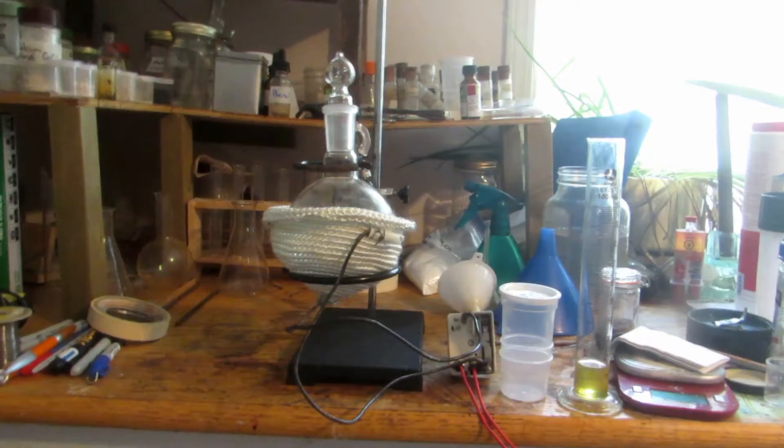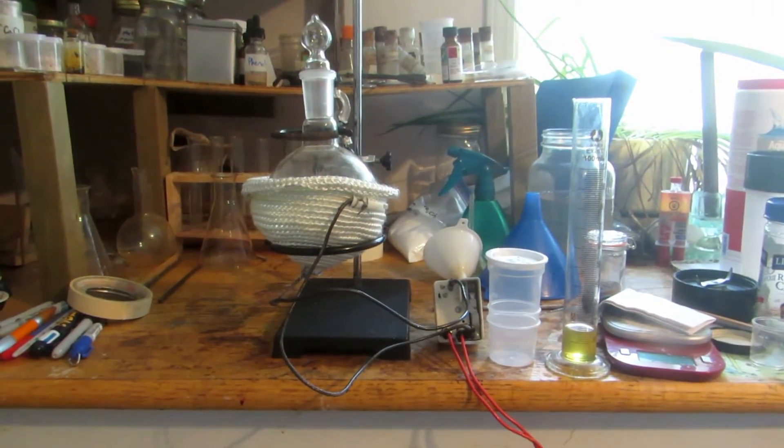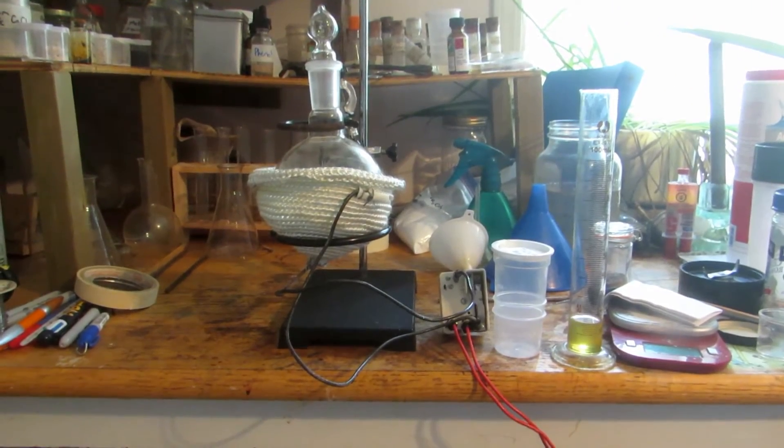After the methanol was added, we're left with a nice clear solution as all the salicylic acid dissolved. That was done by simply swirling the flask around for a moment, and it dissolved quite quickly.